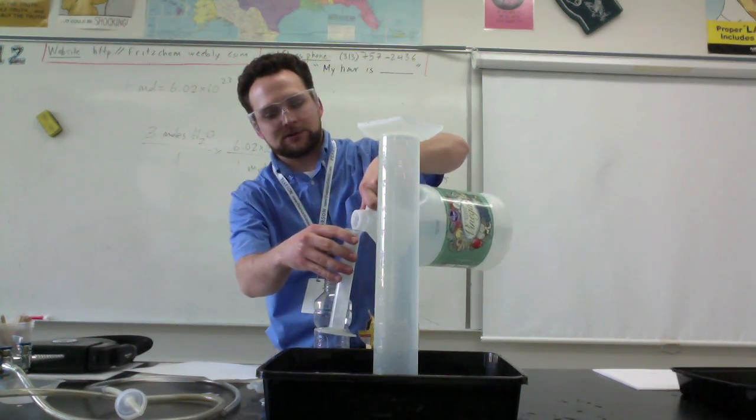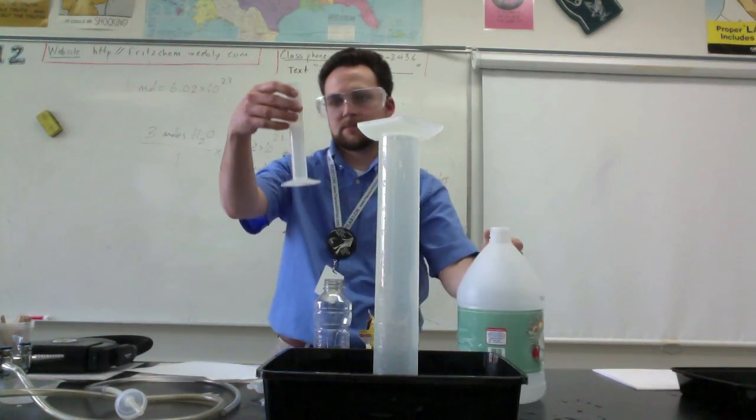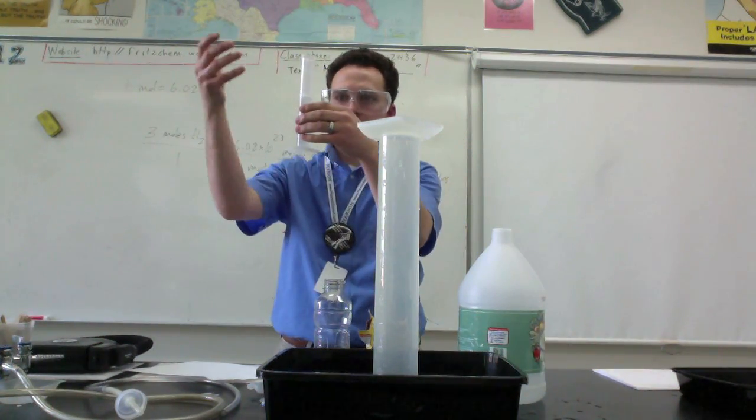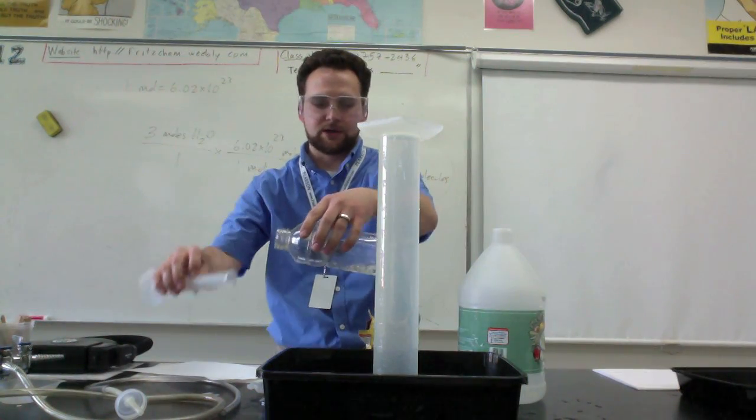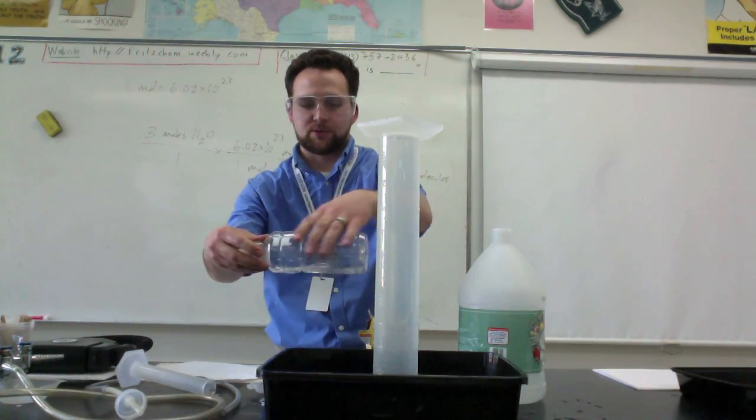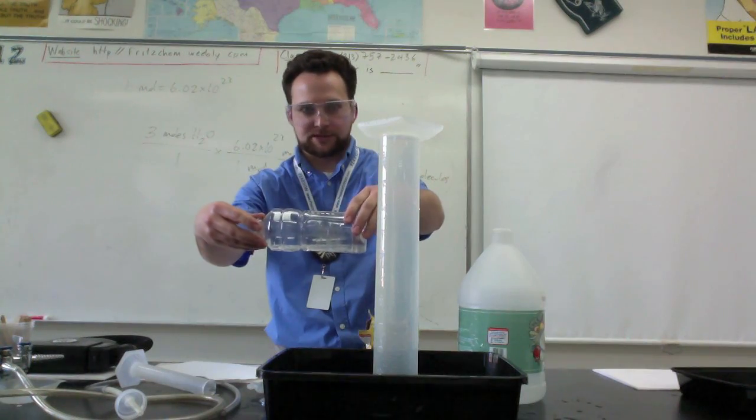So I'll add, let's see, maybe around 40 milliliters of vinegar, see if that's enough. I kind of want to float the boat on that vinegar, so I want to make sure there's enough that it actually floats on top of that.